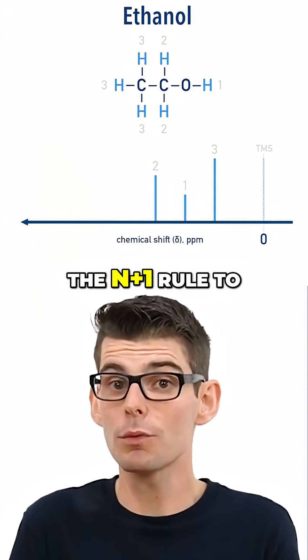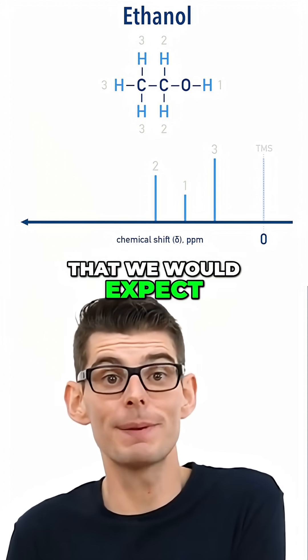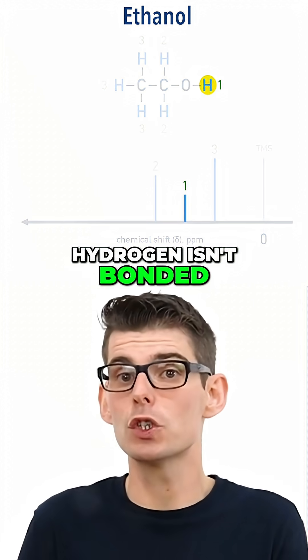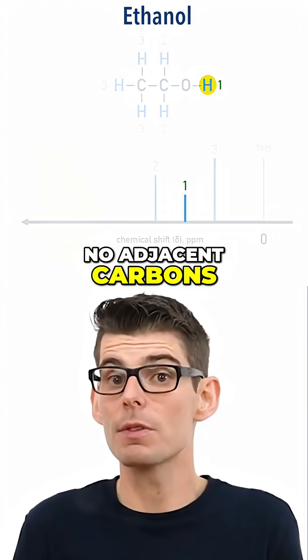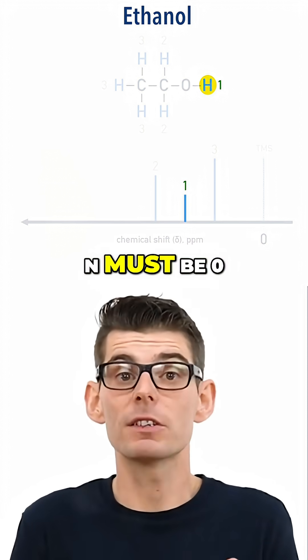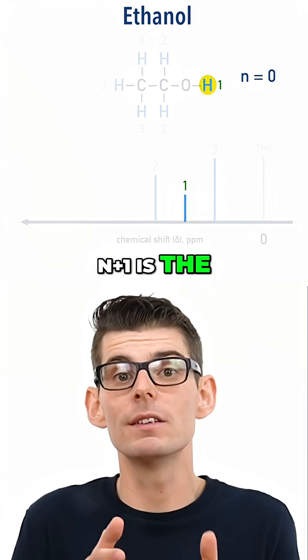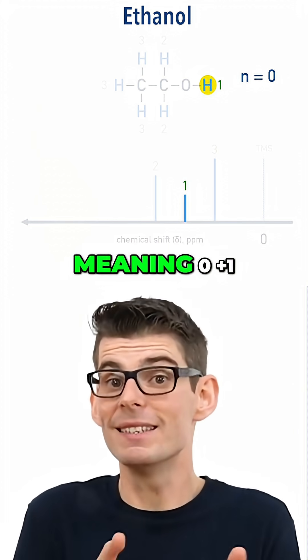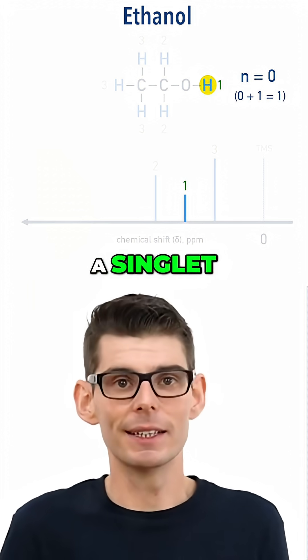We can use the n plus 1 rule to predict the peak splitting that we would expect to see. The first hydrogen isn't bonded to a carbon, meaning there are no adjacent carbons bonded to it either. As a result, n must be zero. Remember, n plus 1 is the number of times the peak gets split, meaning 0 plus 1 is one peak — a singlet. No peak splitting has occurred.